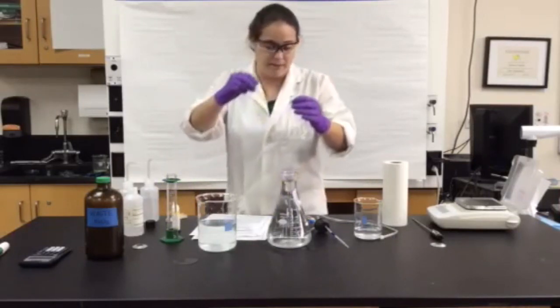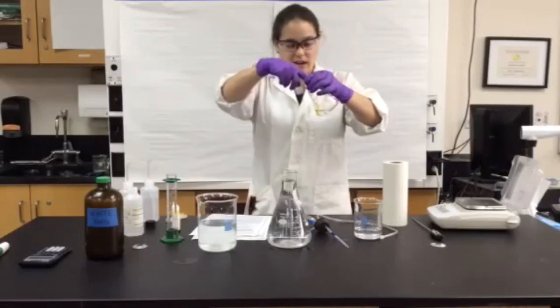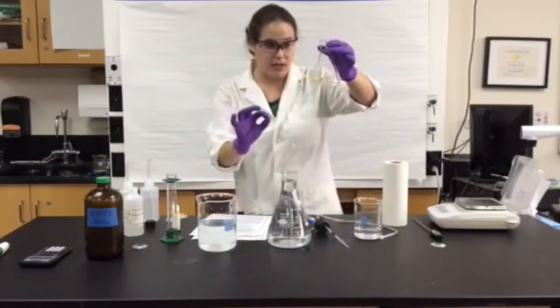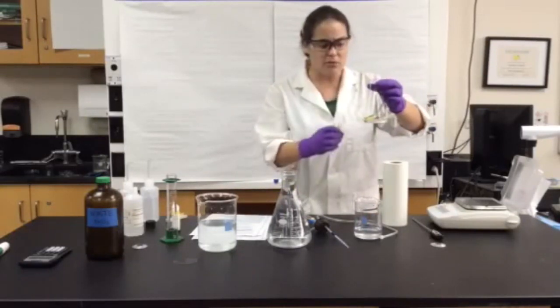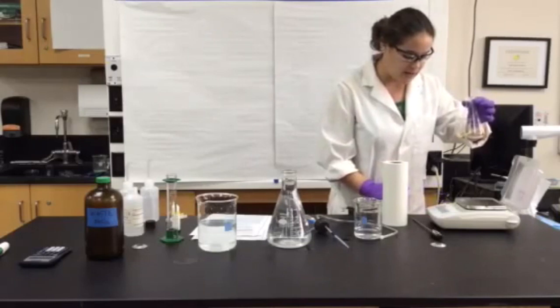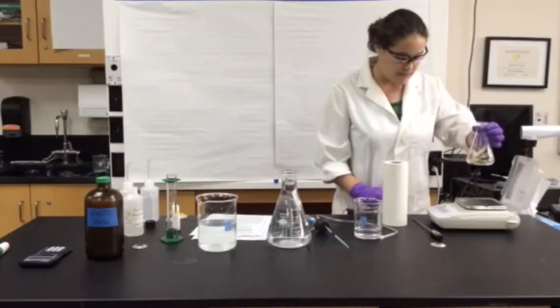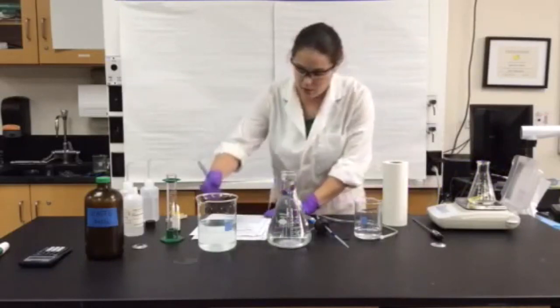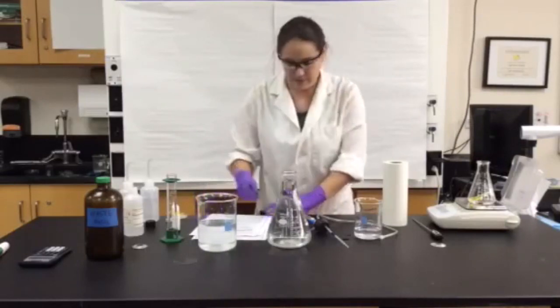Now the next step is pretty tricky. You have to slide the test tube into the Erlenmeyer flask and kind of rotate it around so that the test tube won't fall. It's actually pretty hard to do. I would test this with your test tube before you put the liquids in. Make sure that your test tube is just long enough so that it will balance itself above the liquid line. Then we're going to take the mass of this Erlenmeyer flask plus the reactants. Wait for your scale to zero and place the flask down. Write down the mass of flask A and its contents in your lab notebook.